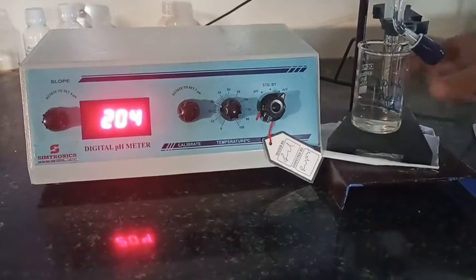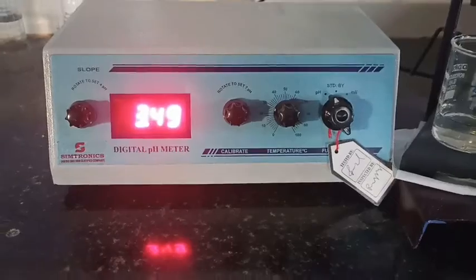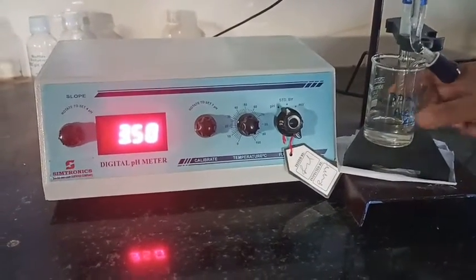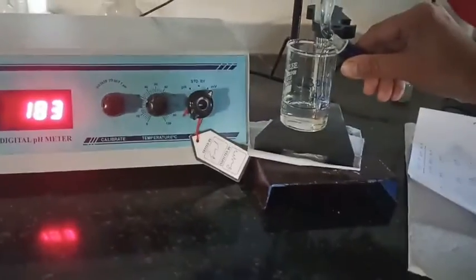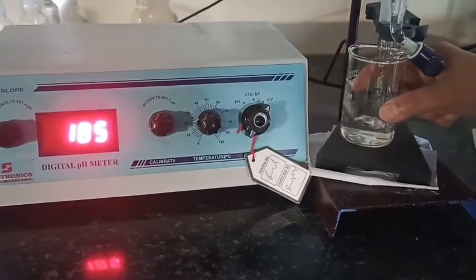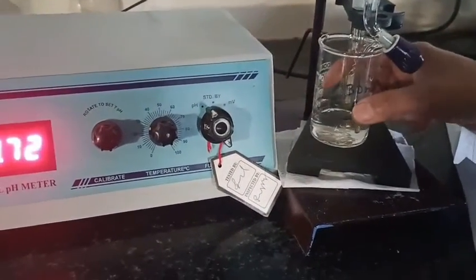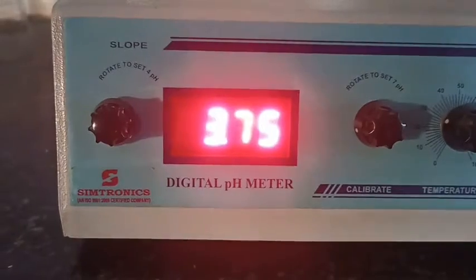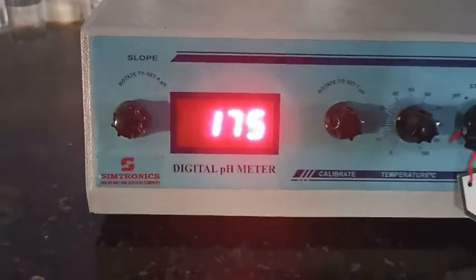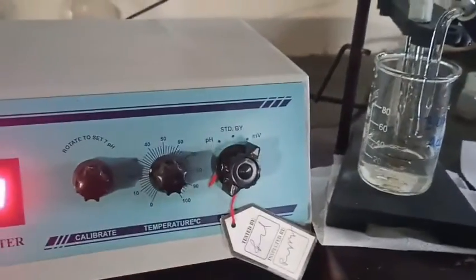This is my pH reading and this is the potential reading. Now I add 1 ml of NaOH solution and check the pH — here you can see a reading of 3.49 after adding 1 ml. I continue adding NaOH from the burette to the beaker and record the pH as well as the potential readings. Initially the readings increase; at 5 ml of NaOH added, the pH is 3.78 and the potential value is positive.